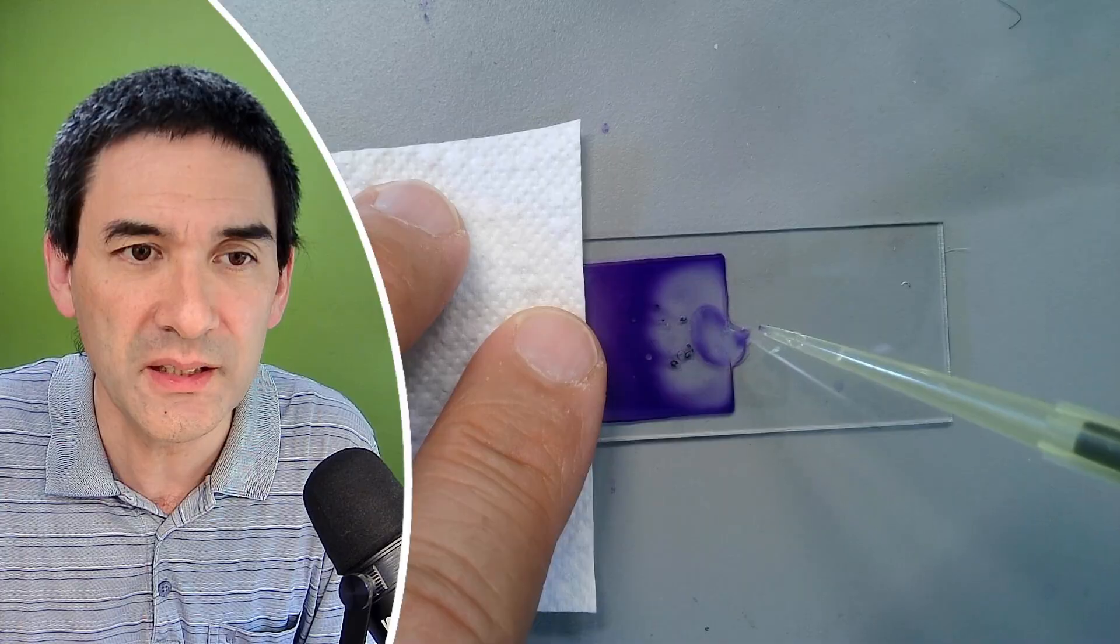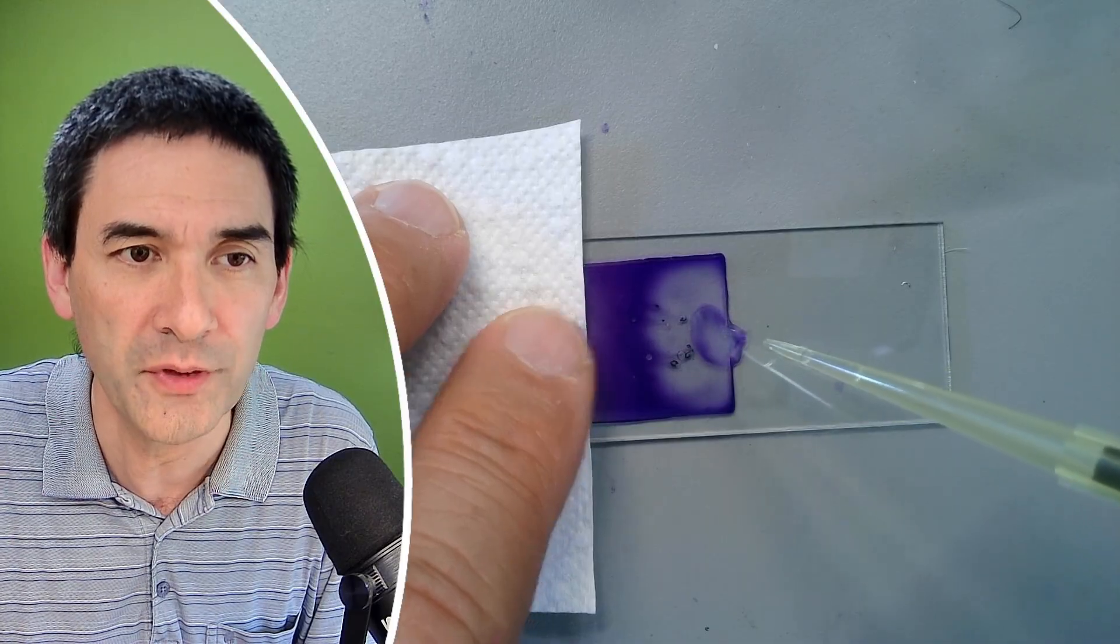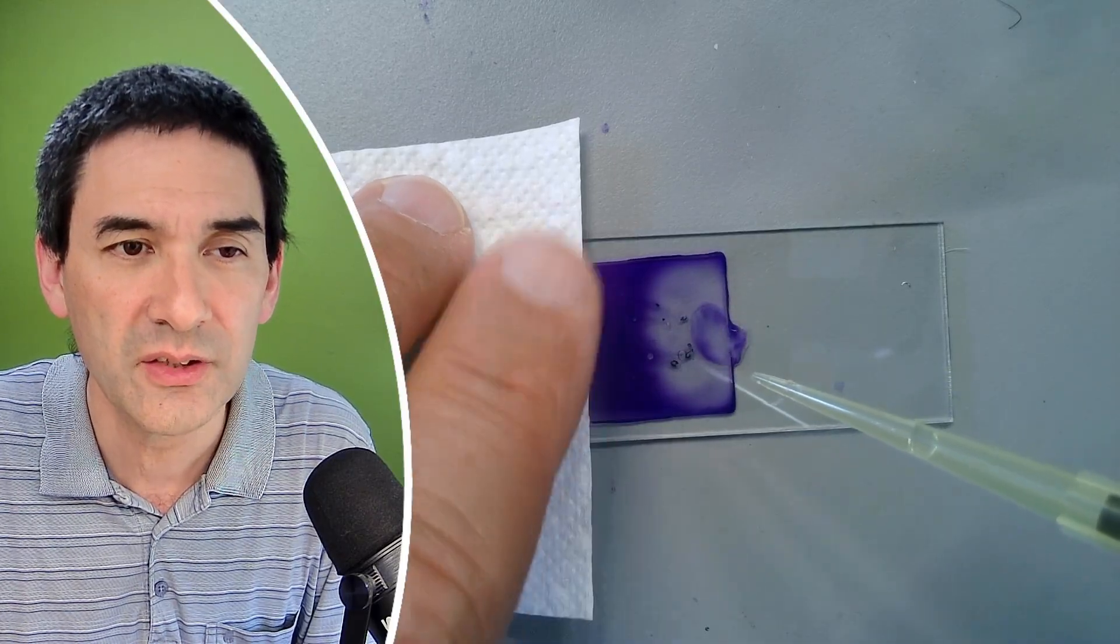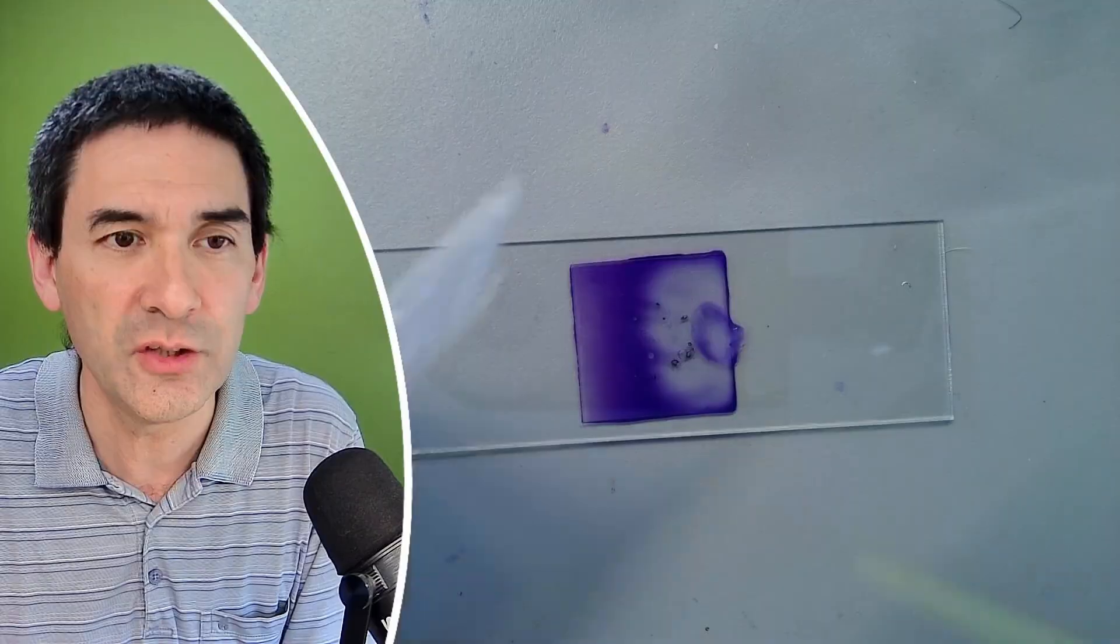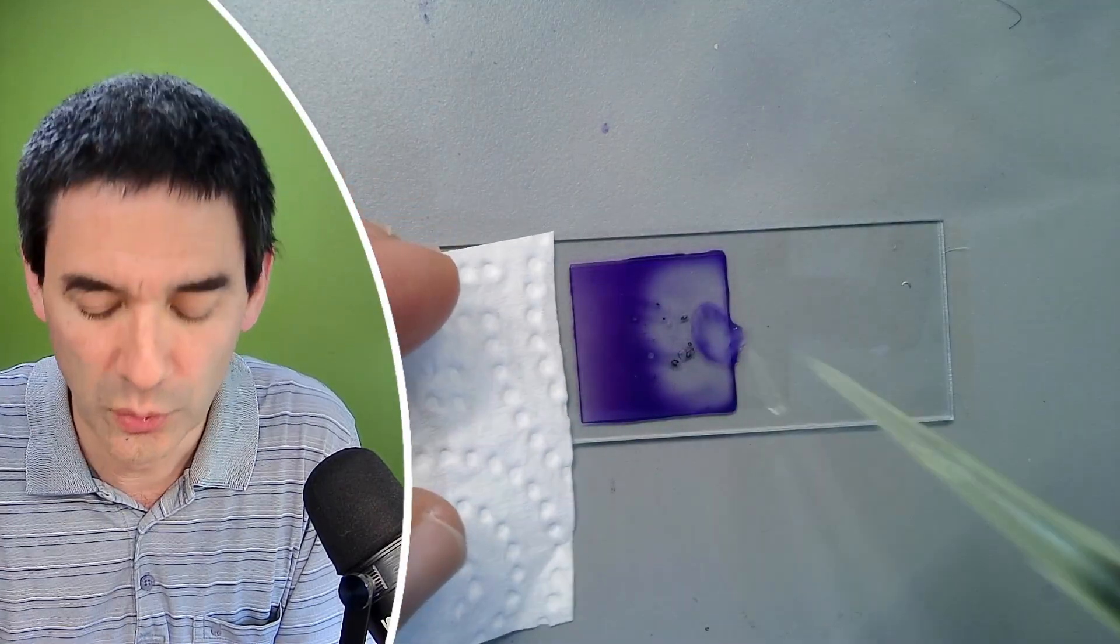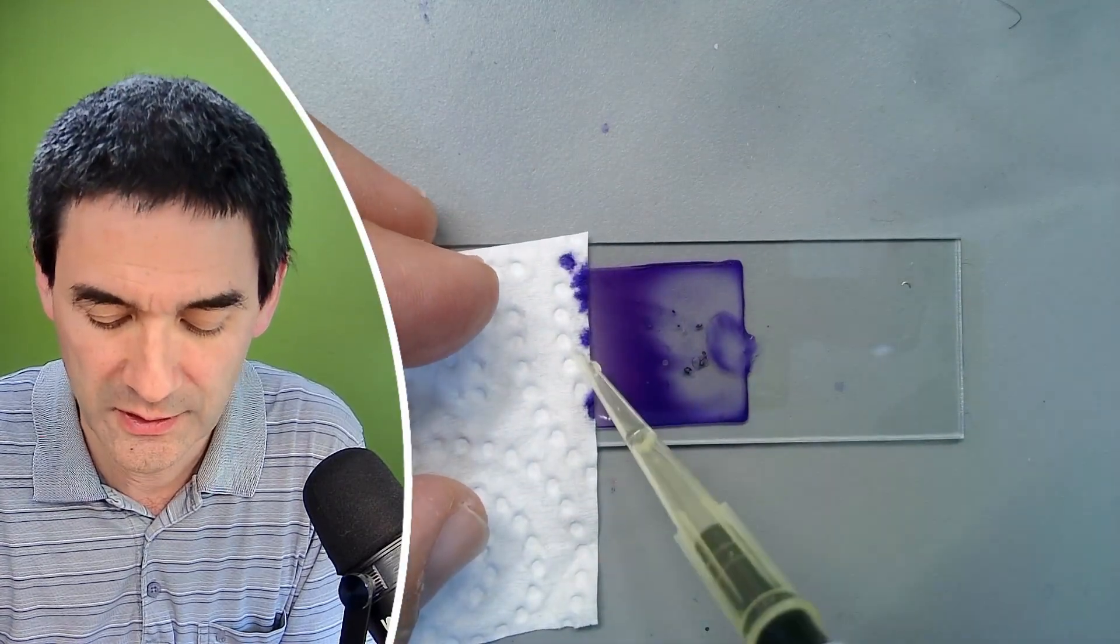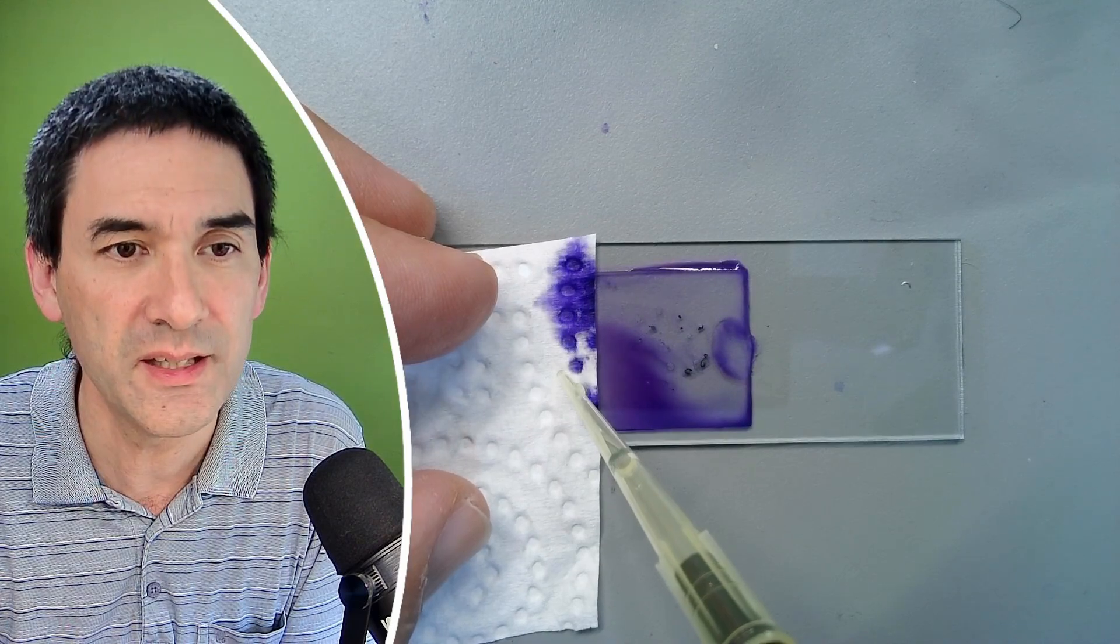Of course now I made the mistake that I got some of the water also on top of the cover glass. So that is of course a disadvantage, but you can actually try to remove some of the, see over here like this, here we go.